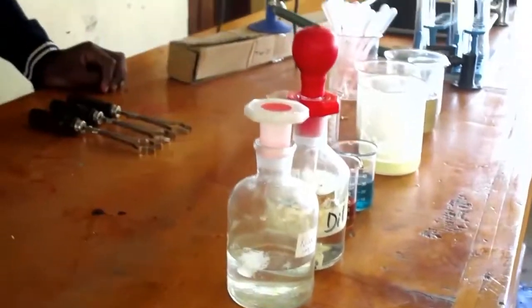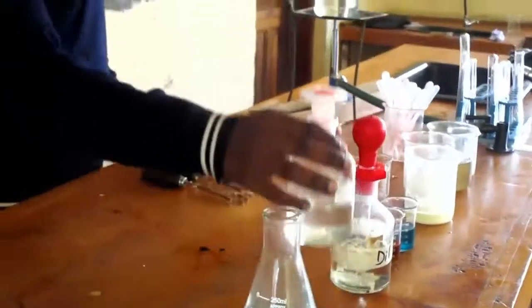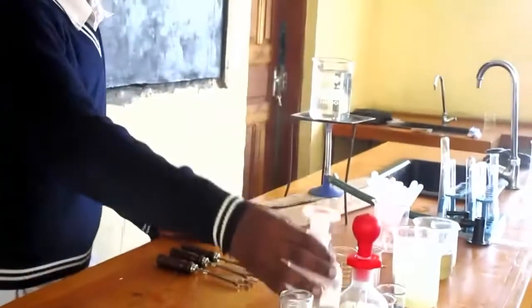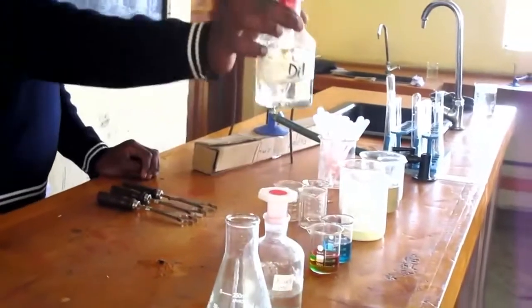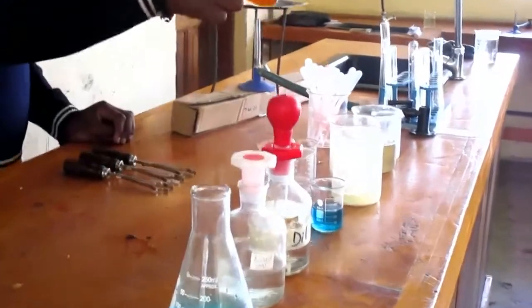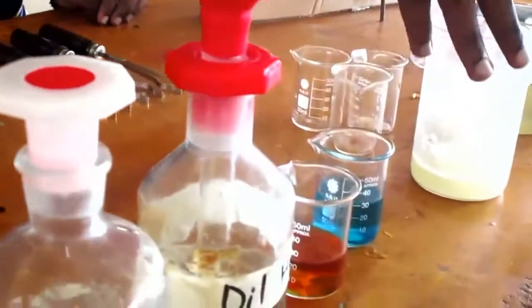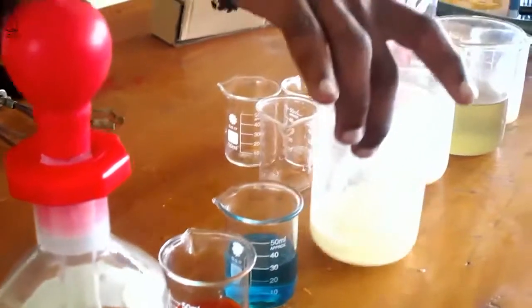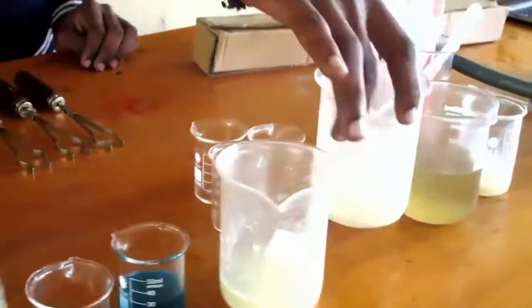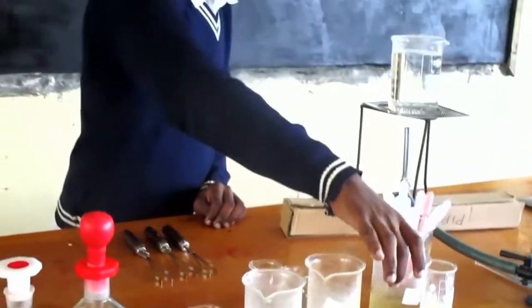Here we have got copper sulfate, we have got sodium hydroxide, hydrochloric acid, iodine solution and Benedict solution, sample A, sample B, sample C, sample D.